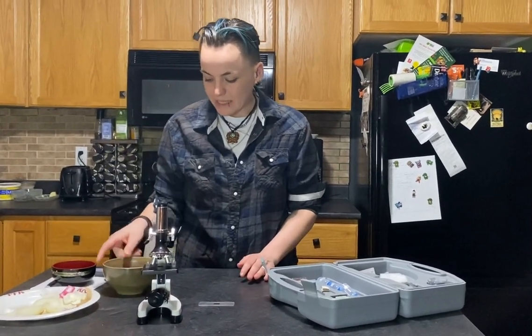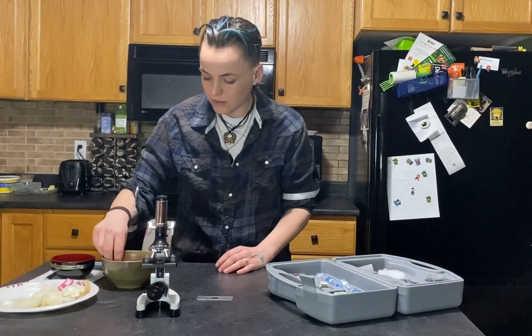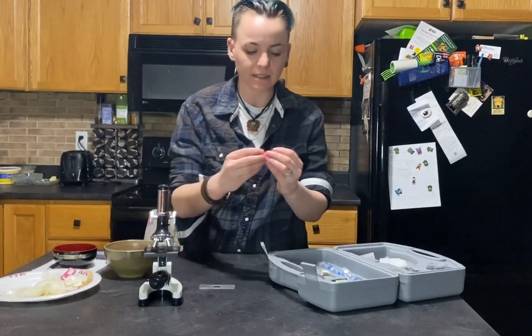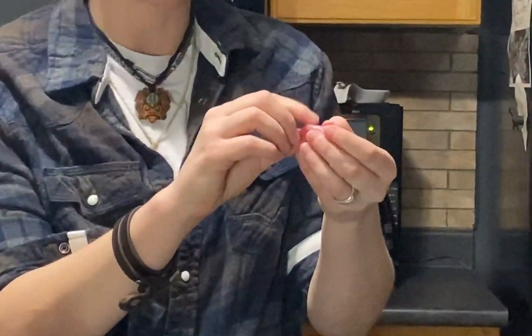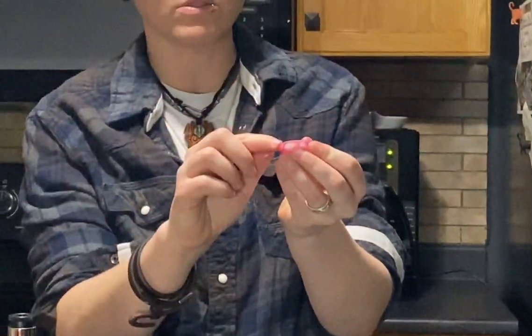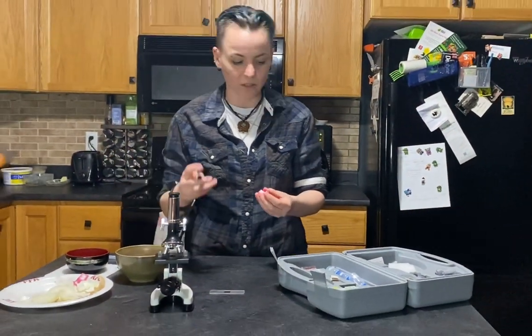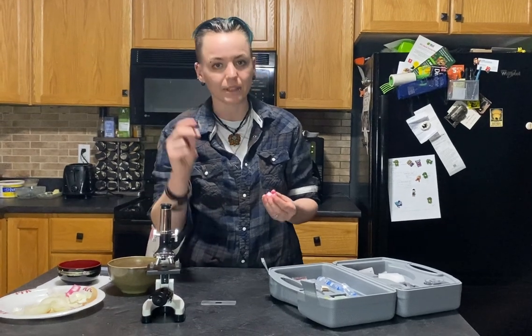After you've let your pieces of onion soak in the dye for a little while, you want to pick one out — something a decent size like this — and you're going to want to pick off the layer. There's basically a membrane, which is the onion skin. Just like we have skin, they have skin. So you're going to want to pick the skin from the inside part of the onion — this is the outside, this is the inside, you want the inside part. You're given forceps in your kits and also a little knife-like tool.